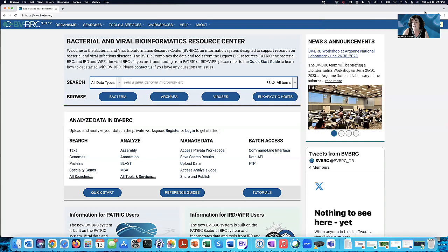Let's do a quick demo. And this is the Bioinformatics Resource Center. It's at bv-brc.org. Now, the one thing they ask is that you register for an account. When you register for an account, you get a workspace with unlimited size at this moment, and you can run any of the pipelines. It doesn't cost you anything.